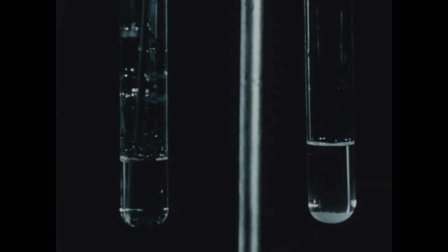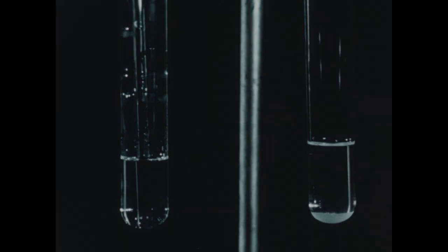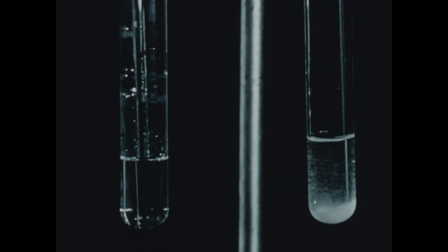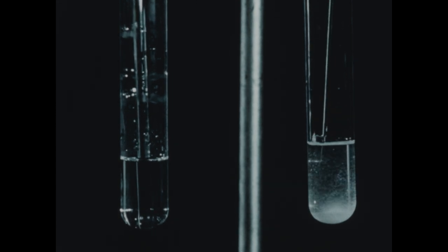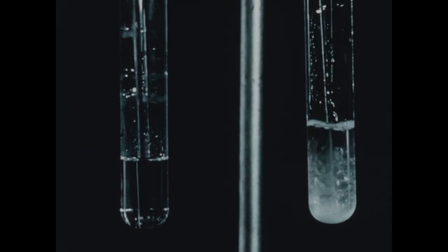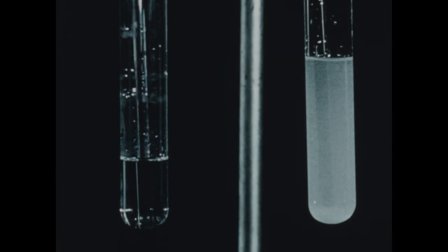After a few moments, we see that the sugar has completely dissolved in the water, while the alcohol has not acted as a good solvent for sugar. Most of the sugar still remains on the bottom of the tube. Sugar, then, is not very soluble in pure alcohol. Is it soluble in a mixture of alcohol and water? We can easily answer this question by adding some water to the tube containing the sugar and the alcohol, and again stirring for a few moments.